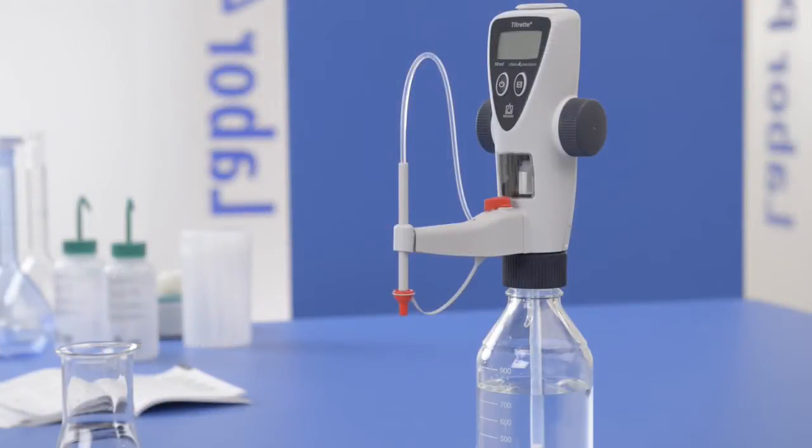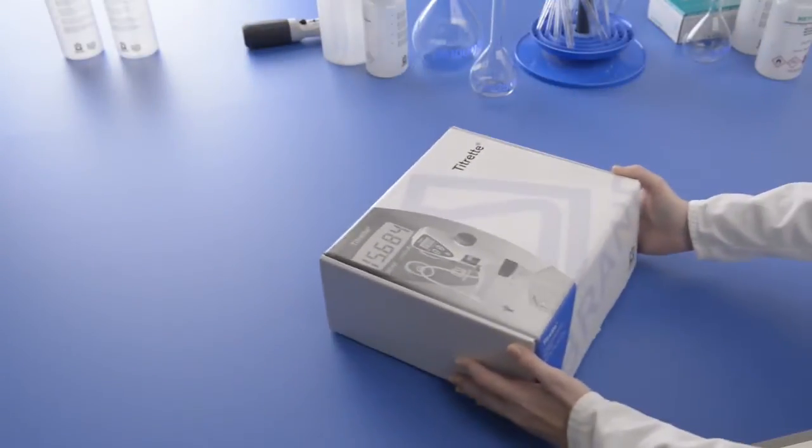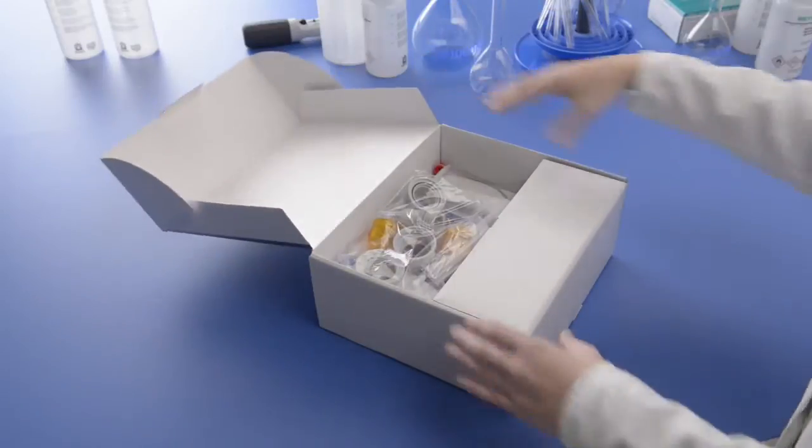Just a few steps to get the Titrette ready for use. First, open the packaging and inspect the contents: Titrette, batteries, accessories, and user manual. Everything is included.